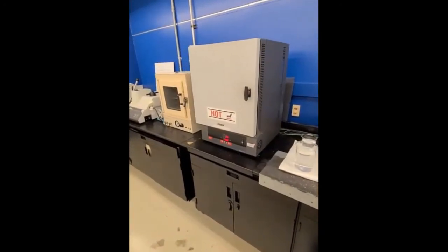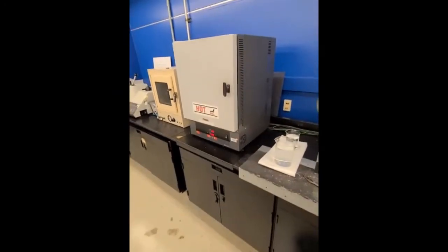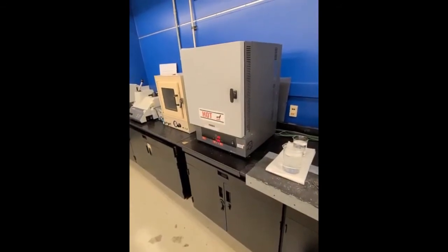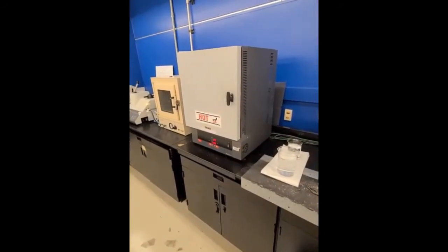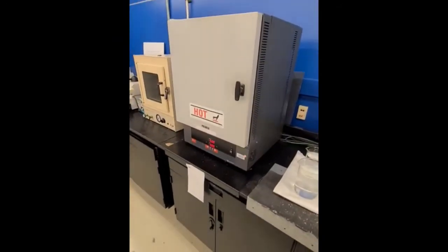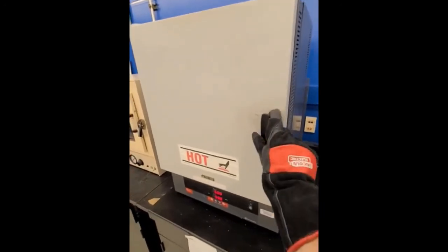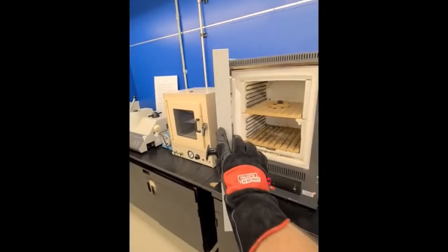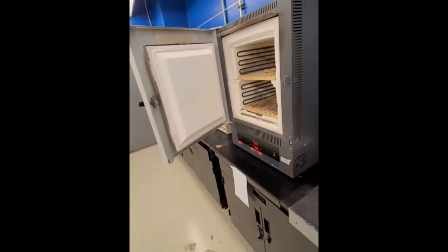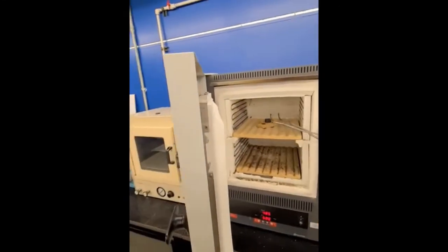All right, so we'll let this ramp up, and I'll come back after 6 hours and after we've given this the tempering treatment that we're targeting. And we'll quench it down and we'll have our 3 main sample sets. So we are at the end of our 6-hour heat treatment. Have a slightly different perspective here on the video so I can show you taking the sample out. It's not as hot, so I can use one hand and get everything done. Okay, so it's not red hot, but it's still warm.